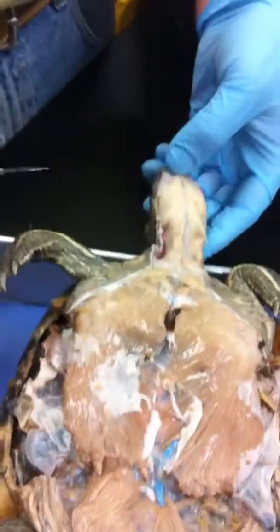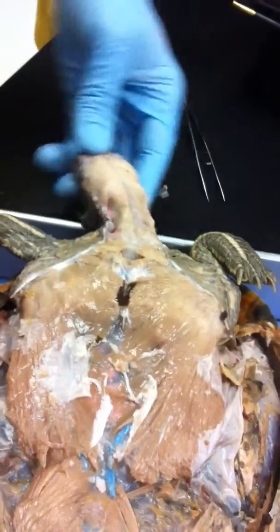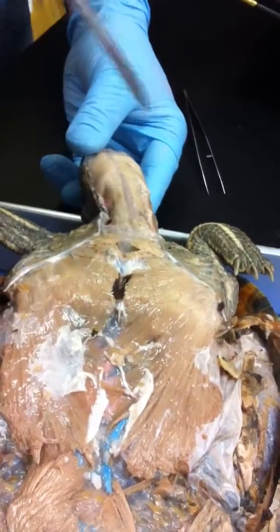These are for the fine movements of the head side to side — the sternomastoid and the omohyoid. Is there another one on the other side? Yes, they're a paired set.